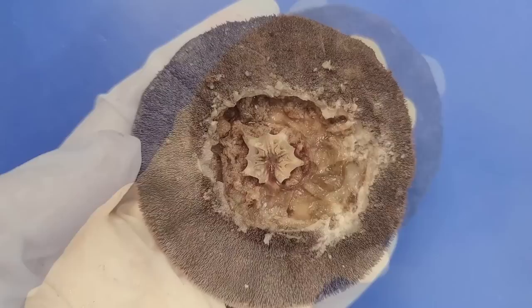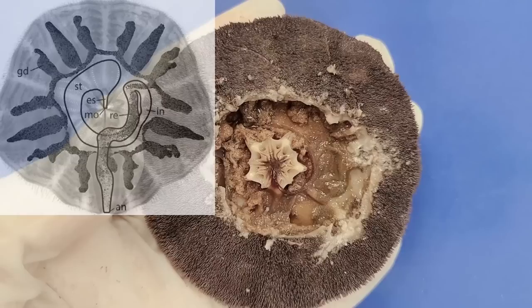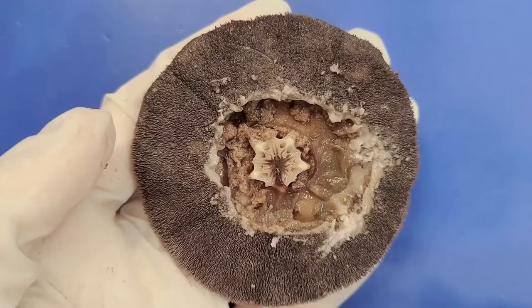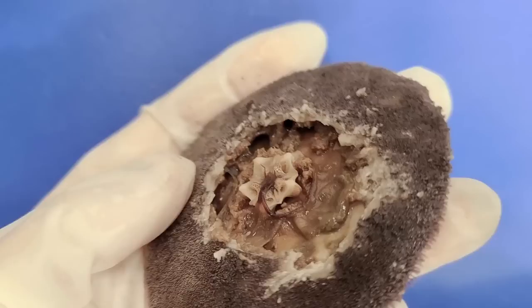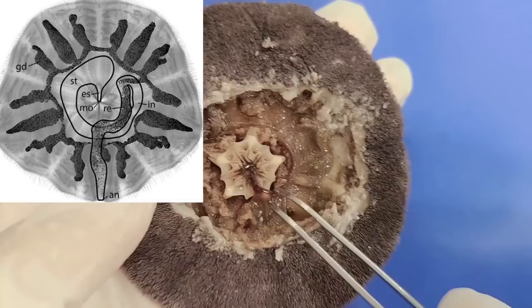Now let's take a look at the digestive system of the sand dollar. It's very similar to the digestive system of the sea urchin, except compressed flat. The sand dollar's digestive system also only does one circular circuit around the body cavity, while the sea urchin's digestive system switches directions and runs another circuit in the opposite direction, giving it two circuits. This white complicated-looking structure in the middle of the floor of the body cavity is called Aristotle's lantern — it contains the mouth and the pharynx and also has five teeth inside of it. At the top of the lantern, the pharynx opens up into the esophagus, which then leads into the wider stomach.